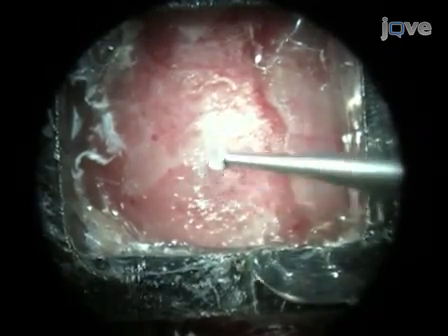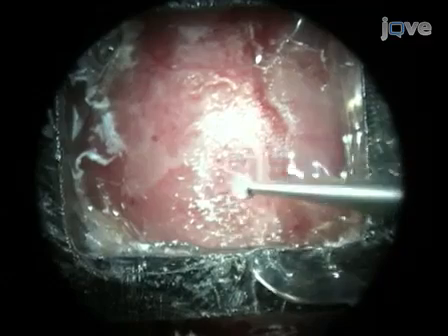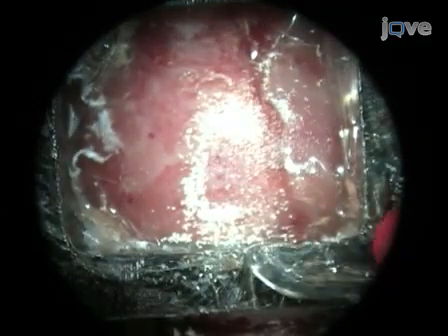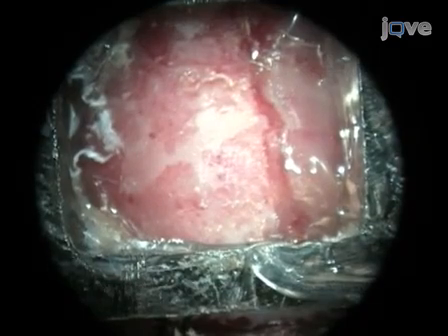Use only light sweeping motions nearly parallel to the skull. Do not use direct downward pressure. Stop drilling every 20 to 30 seconds to remove bone dust using the compressed air. These breaks in drilling allow the skull to cool so that there is no heat-induced damage to the underlying brain tissue.